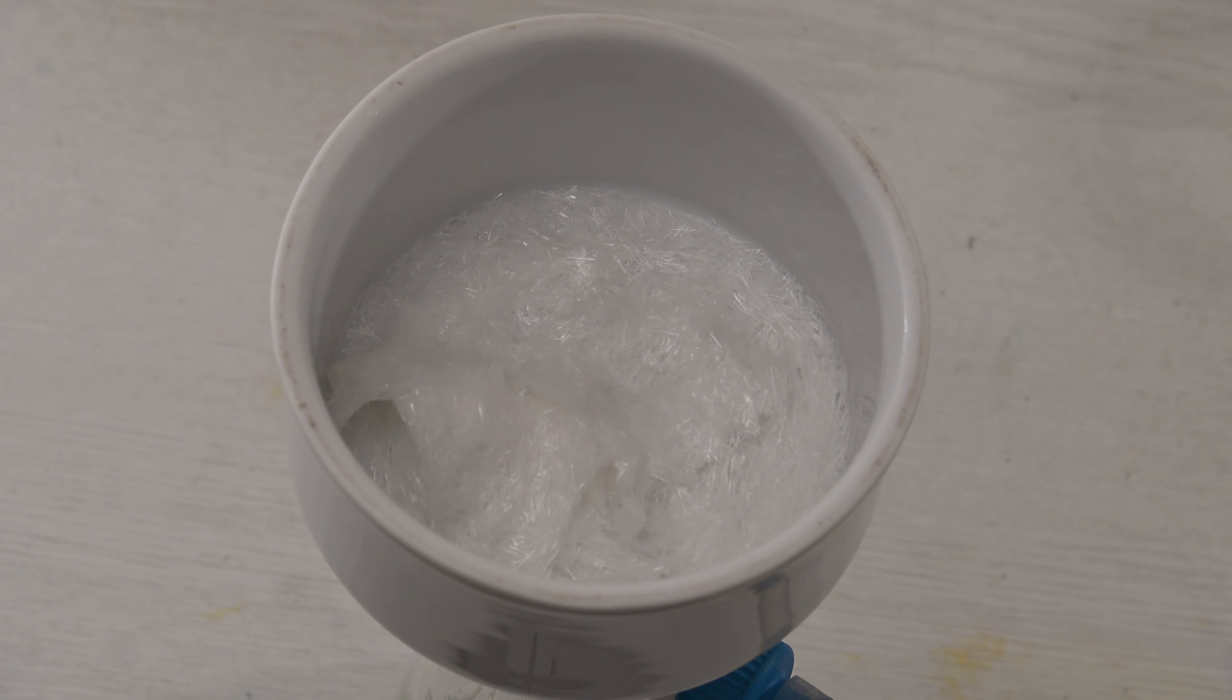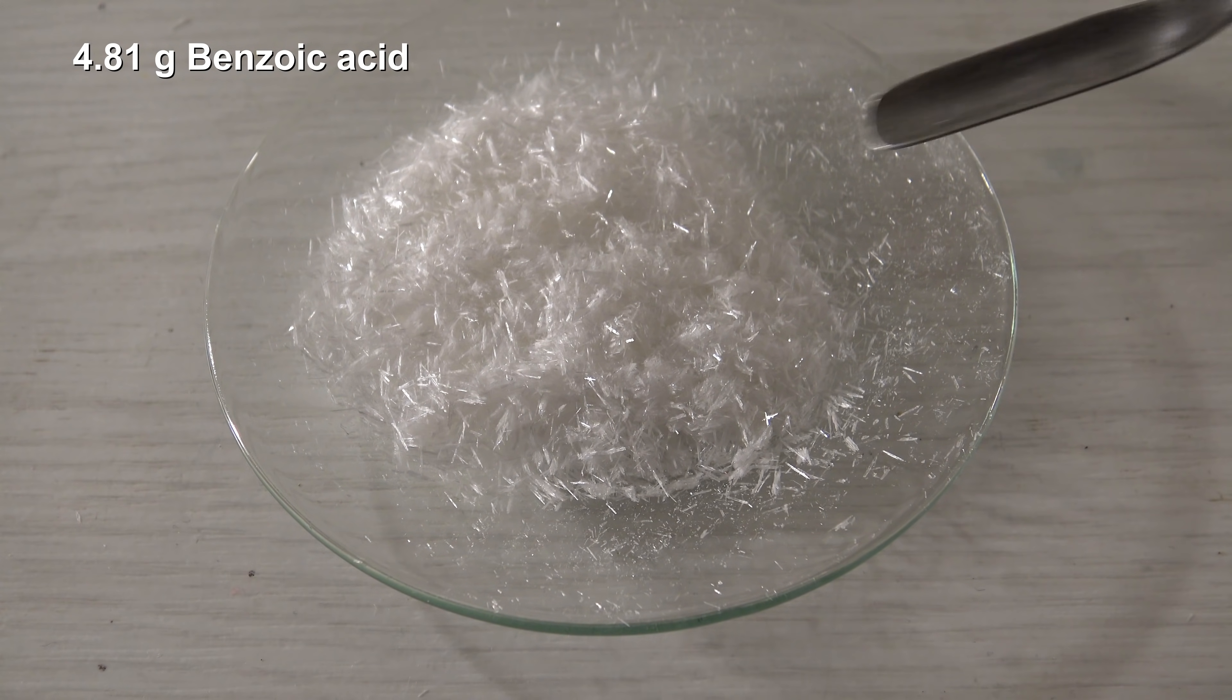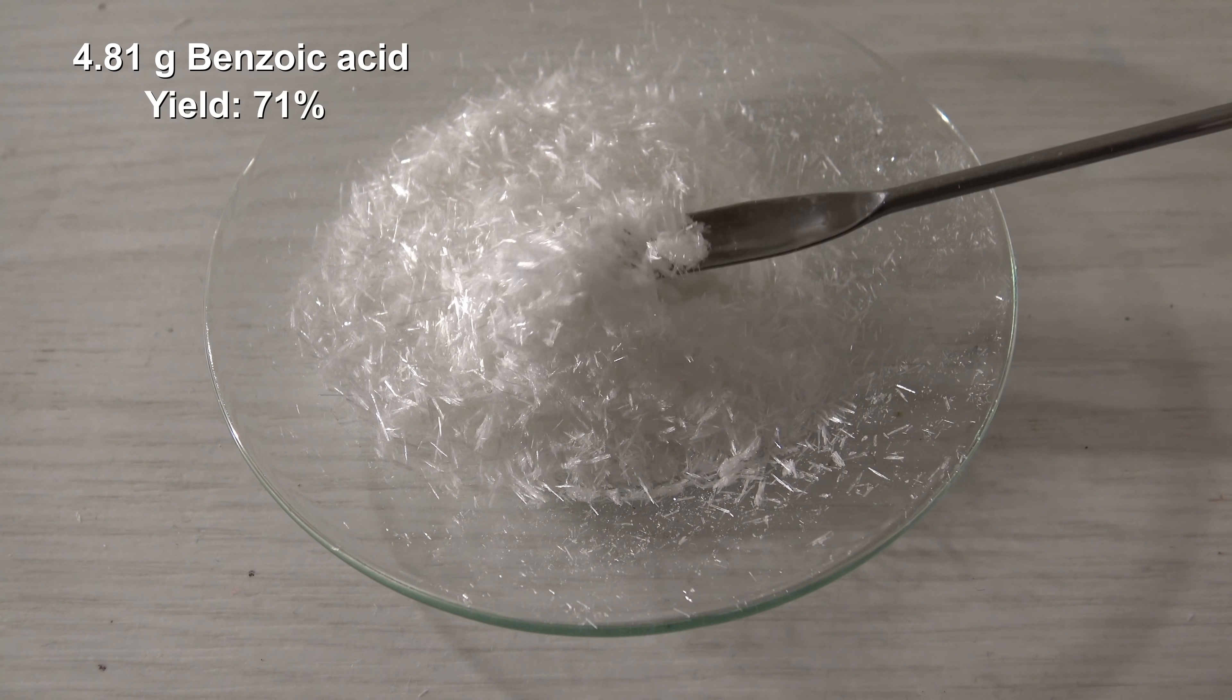The product was washed with water and sucked dry for 10 minutes. After drying it on air, 4.81 grams of benzoic acid were obtained, which corresponds to a yield of 71%.